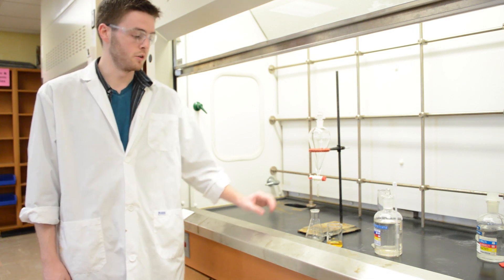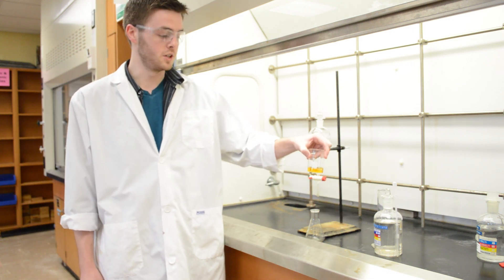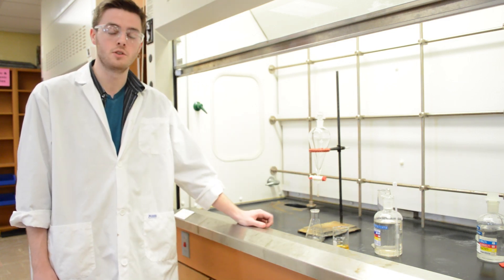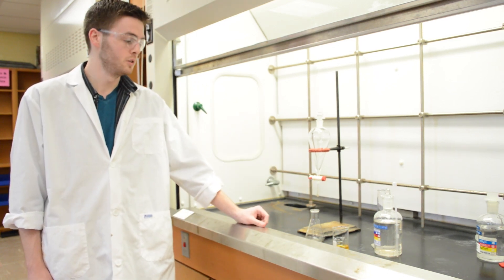In this case we're going to use water here, which I've dyed yellow so that we can see the difference clearly, because water and dichloromethane, which is the other solvent, look the same.